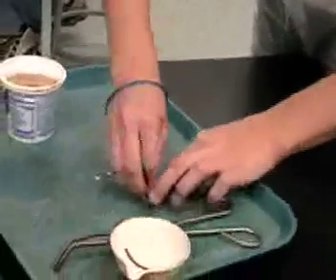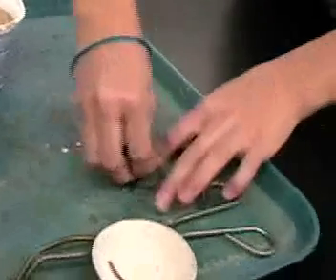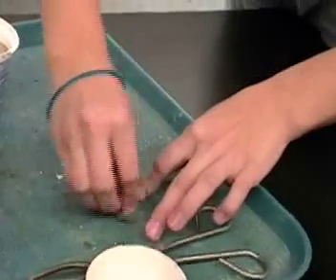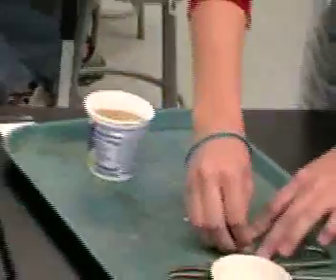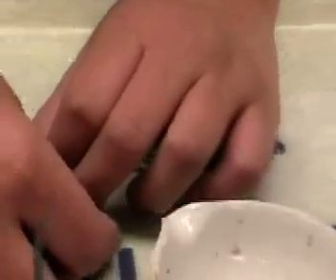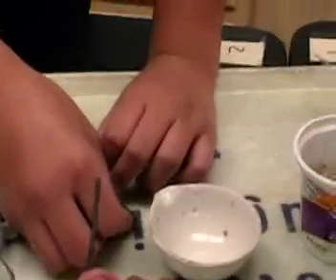You don't want any combustibles. Don't do that. No paper — move your lab books, is what it means. Really scrub. Please don't, Victoria. Please don't have any lab books or other combustible items near the flame.